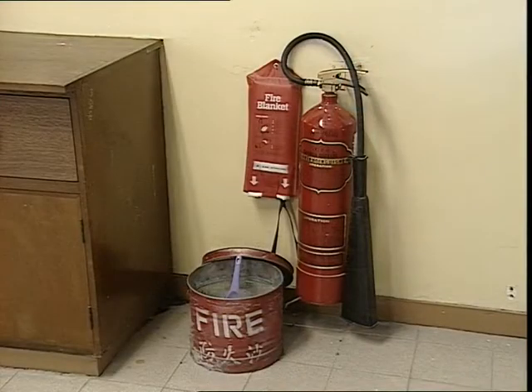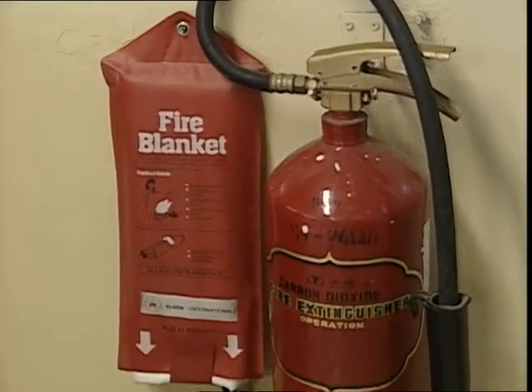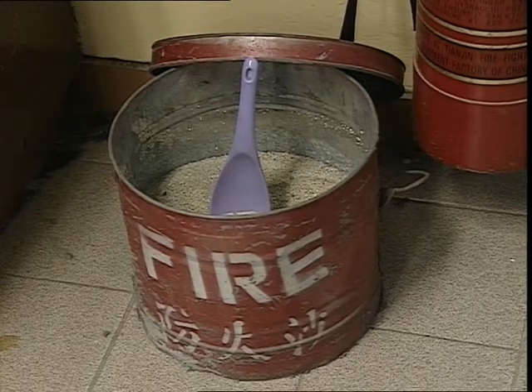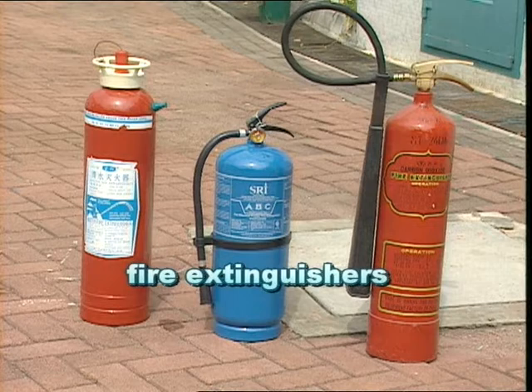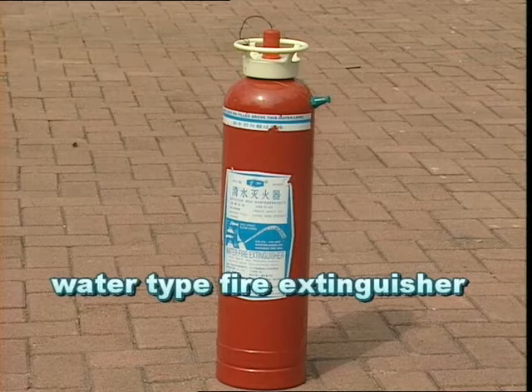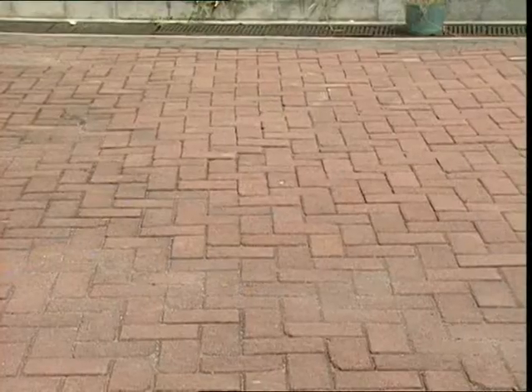Since there are risks of accidents in the laboratory, you should know the means of rescue available and how they are used. These fire extinguishers are installed for putting out fires. The three types of fire extinguishers are frequently found in schools. The first is the water-type fire extinguisher. It can be used to put out ordinary domestic fires.